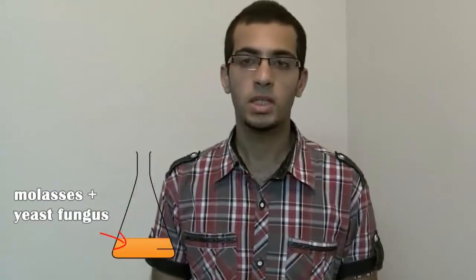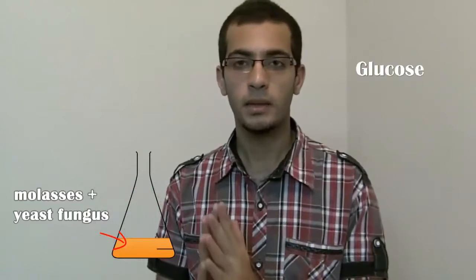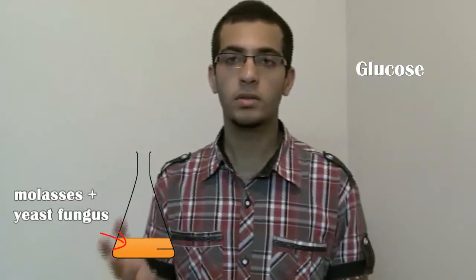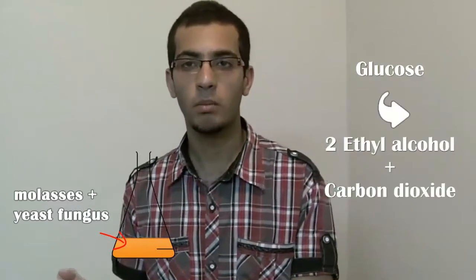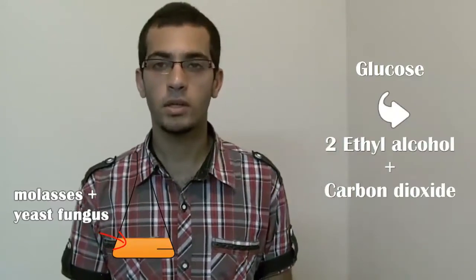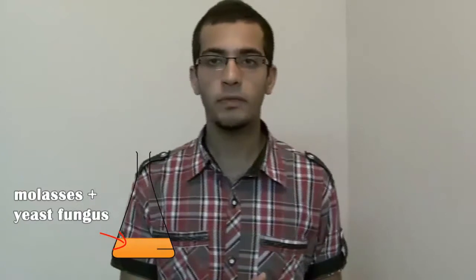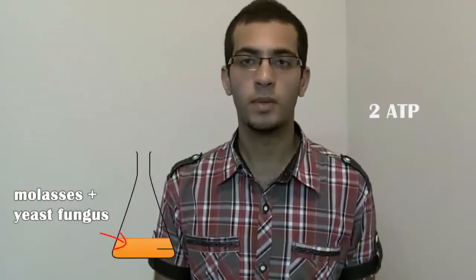The yeast fungus carries out the process of alcoholic fermentation. As we all know, alcoholic fermentation is a type of anaerobic respiration, where the yeast fungus converts the glucose — provided by the molasses or the sugar solution in the experiment — into two ethyl alcohol molecules. Carbon dioxide is also produced, along with an amount of energy equivalent to two ATP molecules. That's why it's called alcoholic fermentation.